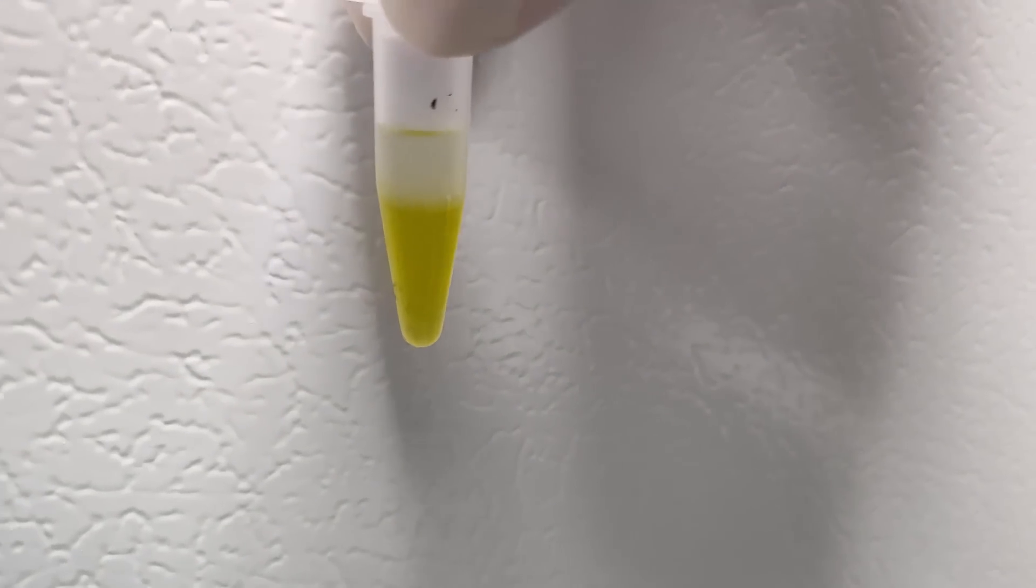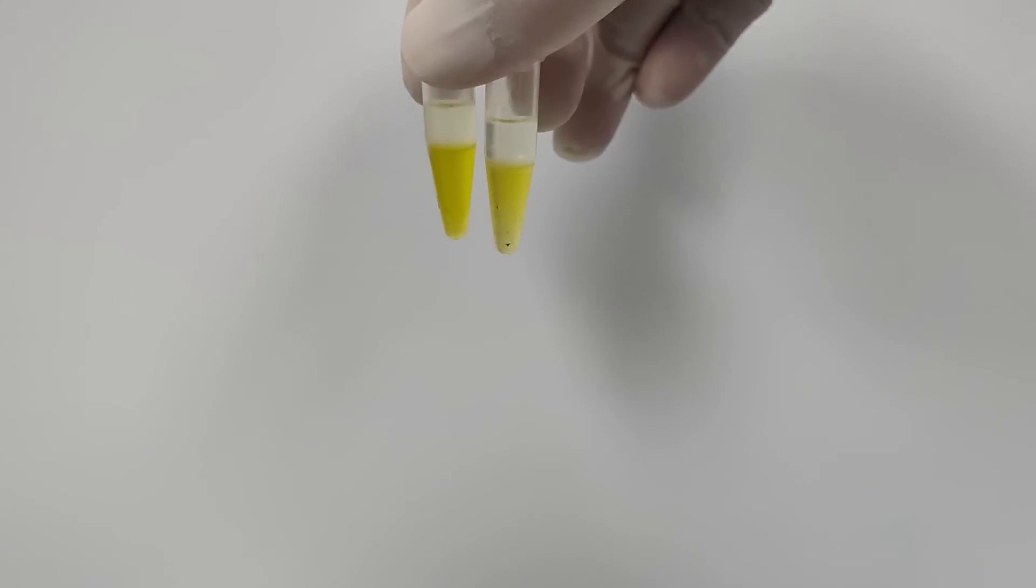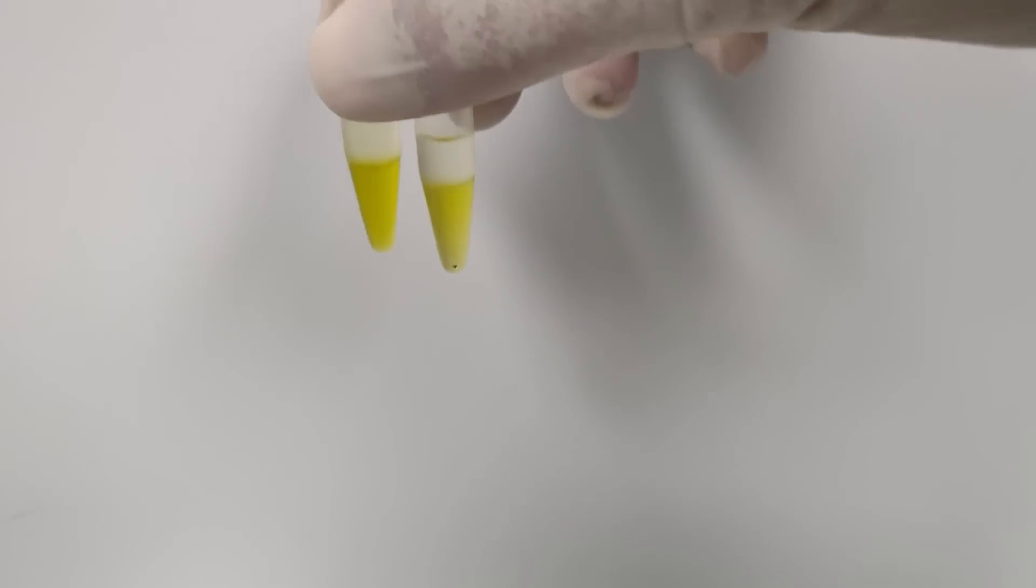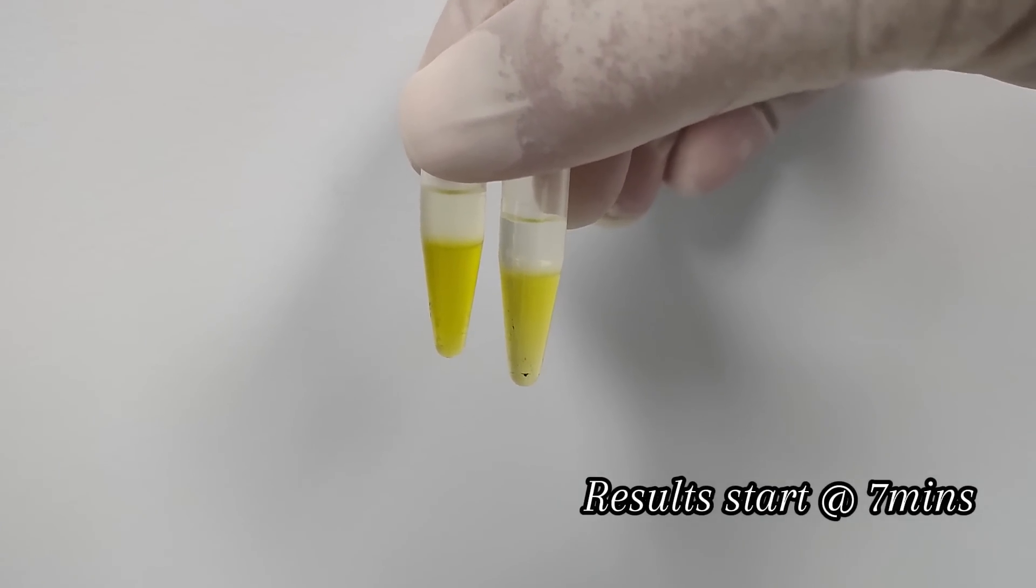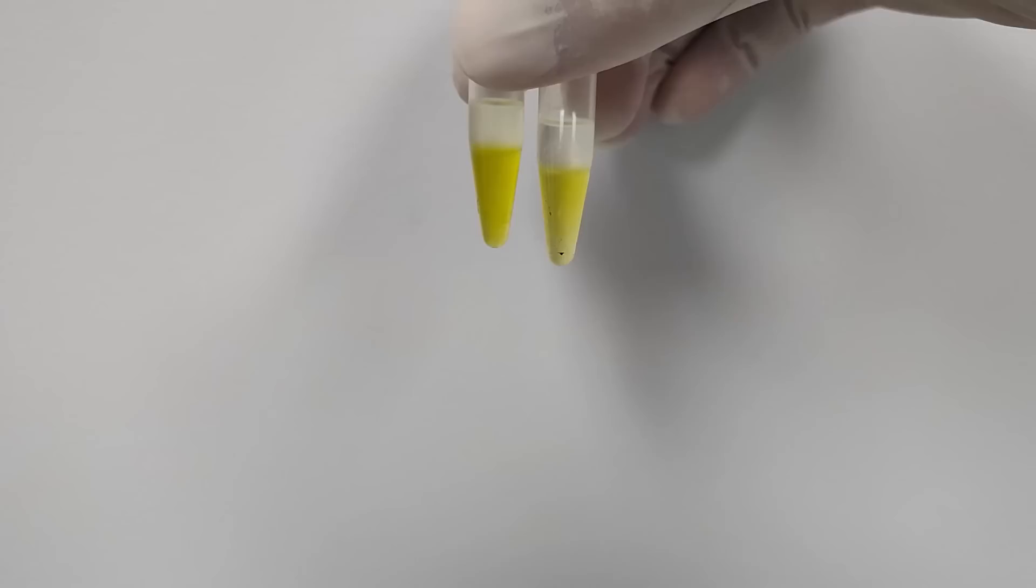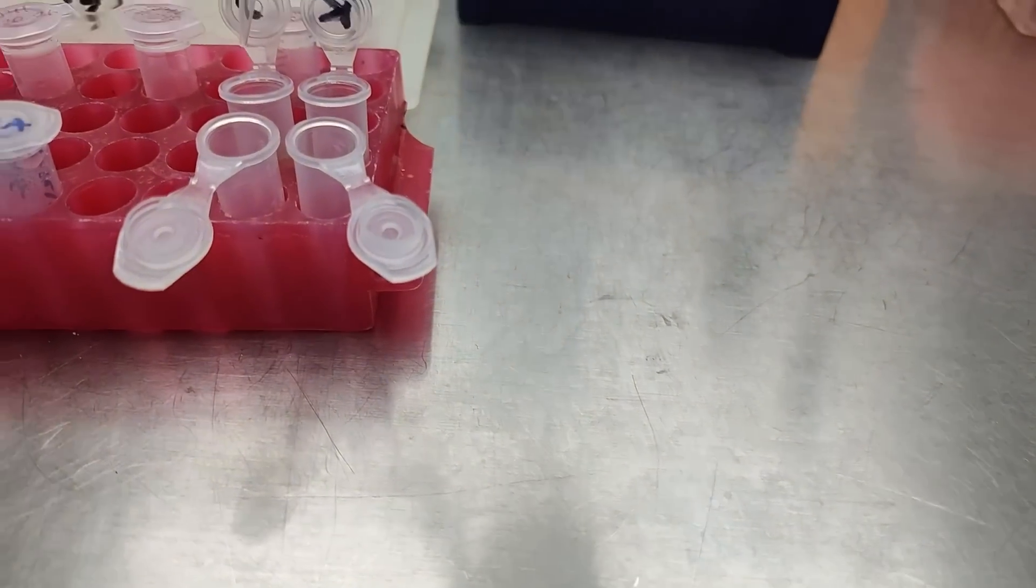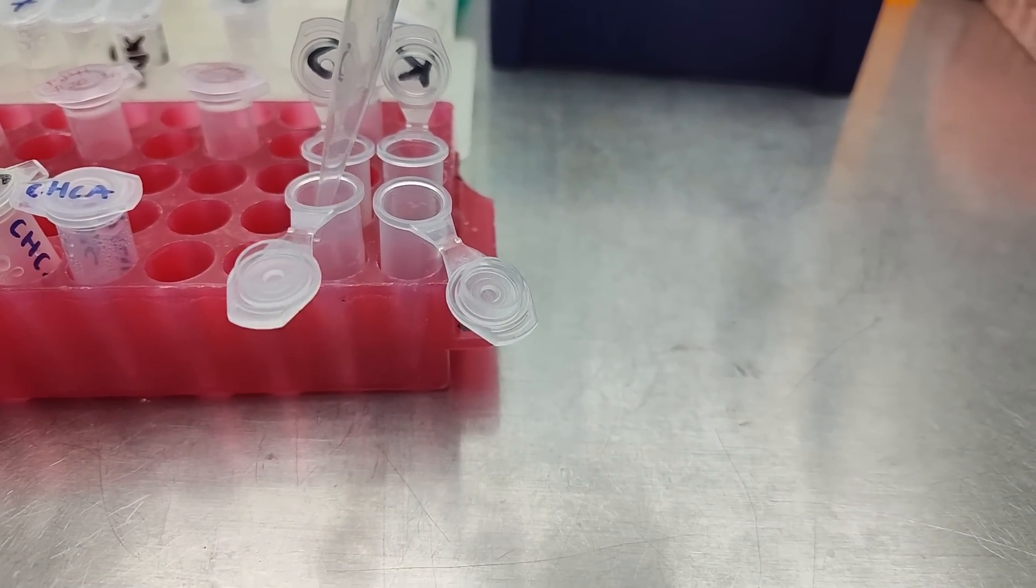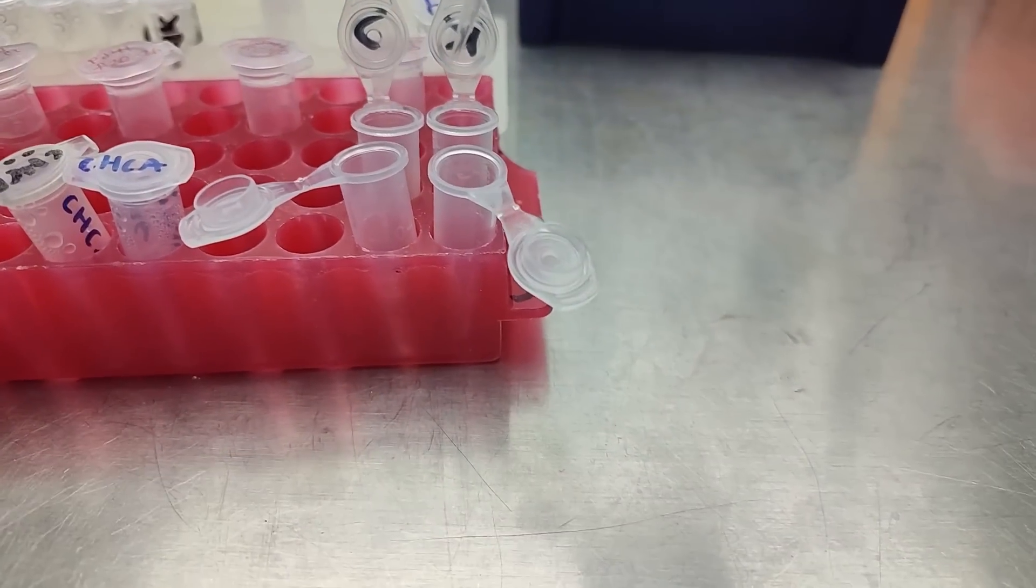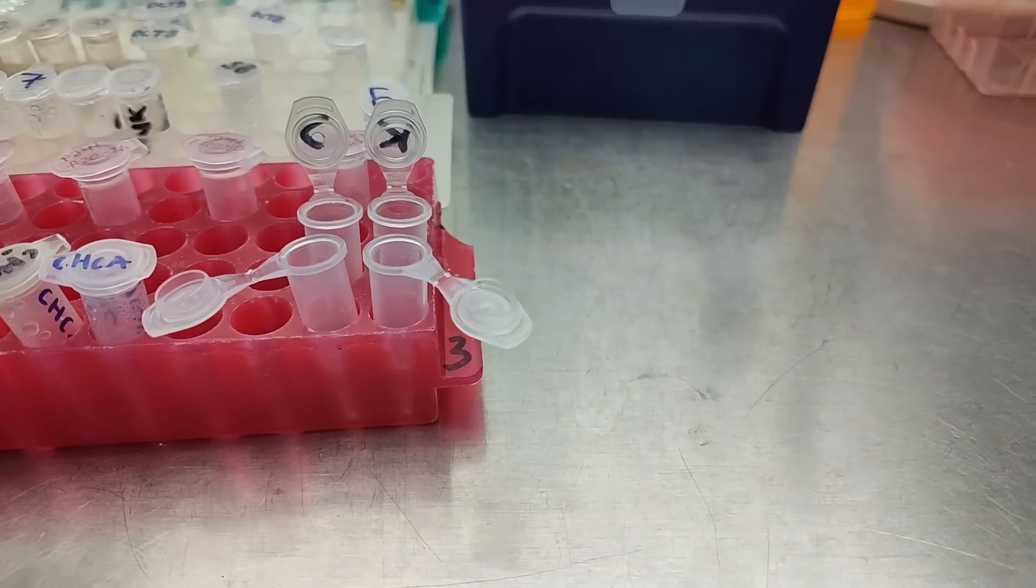Let's see. So we got the Cali. The Cali has kind of like an emulsion on top. That's pretty interesting. So here they are compared. So the Cali on the left now has kind of an emulsion on top, which means it's not as clear. The one on the right is a pretty clean split, very clear on top. So there's definitely some differences going on. There's also a little bit of a gradient difference in the bottom oil remaining. So the goal here is to pull 300 of that top water layer. Try to avoid any of the bottom layer. It does have a bit of a yellow tinge to it in the Cali one. Much clearer than the Kirkland brand. I don't know what that means yet.